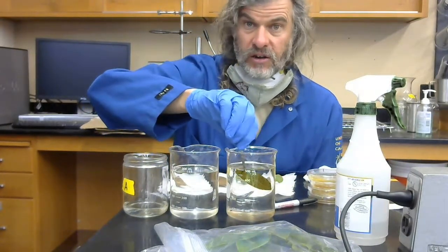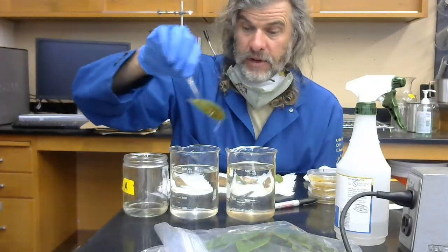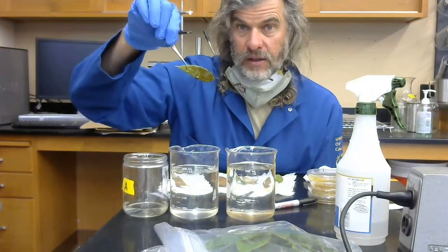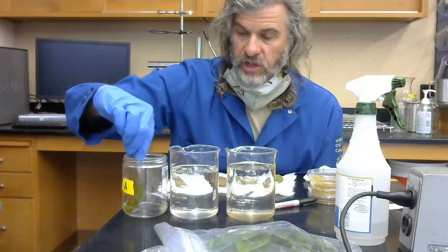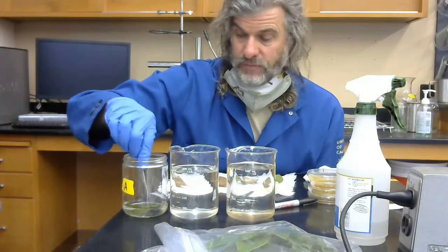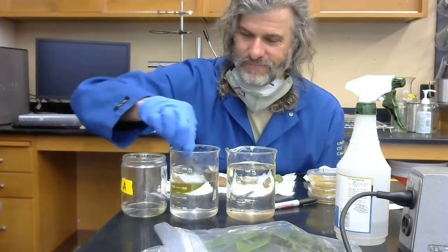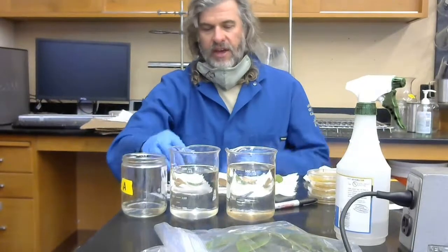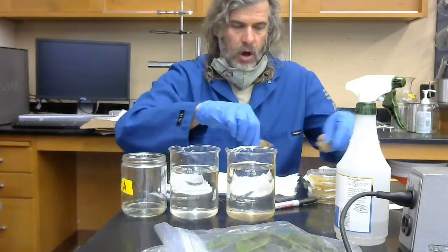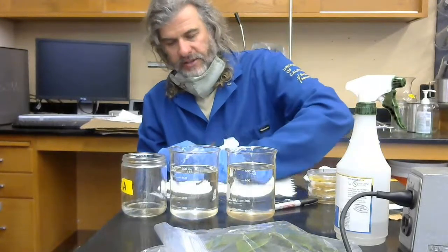I'm going to soak this in here for 5 minutes, or excuse me, 3 minutes, so just imagine that that happened. I take it out, quickly dip it in the water, and then I'm going to put it into the ethanol for an additional 30 seconds. So this is for demonstration only, so just imagine that I have done that. I'm then going to put it in the water again to get the extra ethanol off, and then I'm going to put it down here on my paper towel so that I can process it.